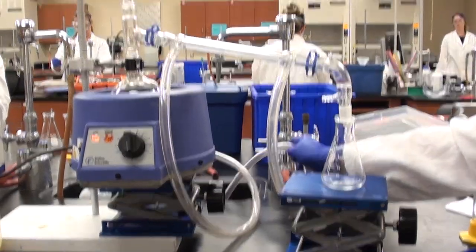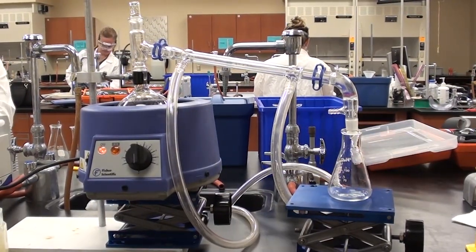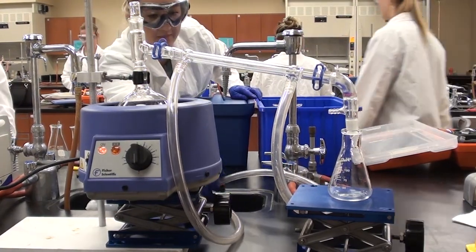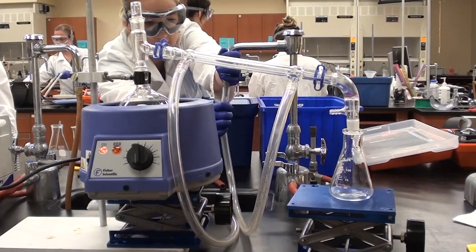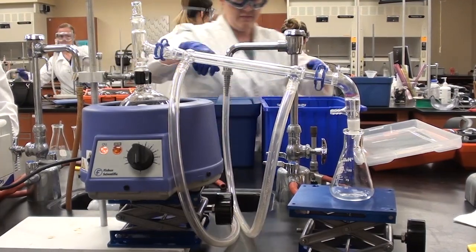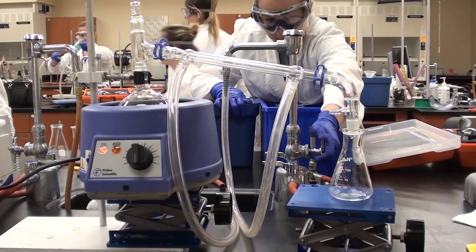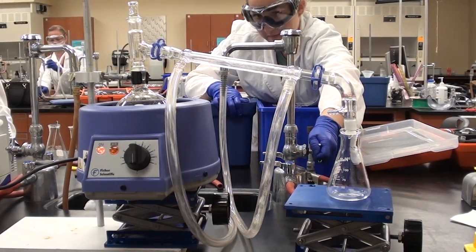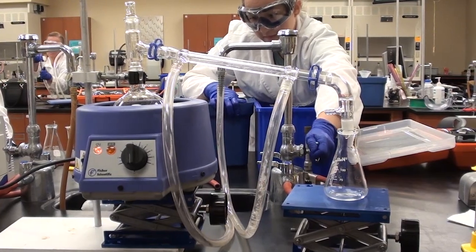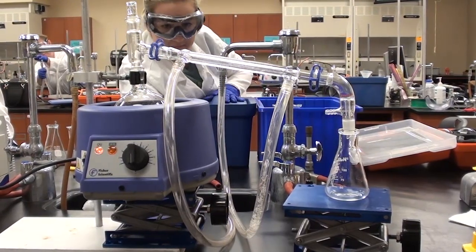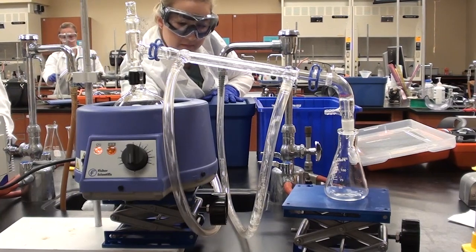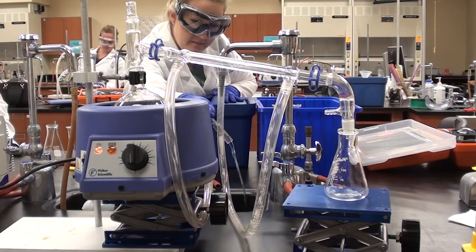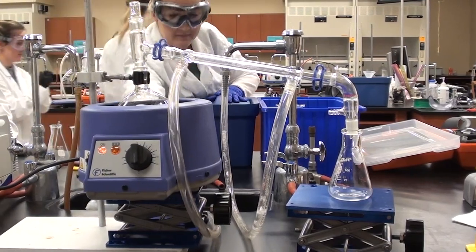We can plug in the water. The water goes in the bottom tube and comes out the top, and the top tube is resting in the sink. She's tying in the bottom tube. She's going to turn on that water. You can see it's not a really heavy flow. That's good.